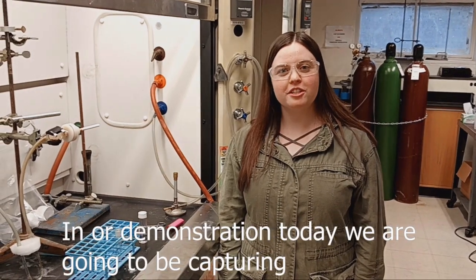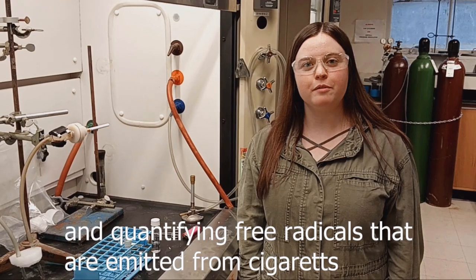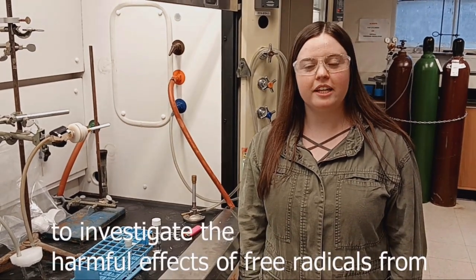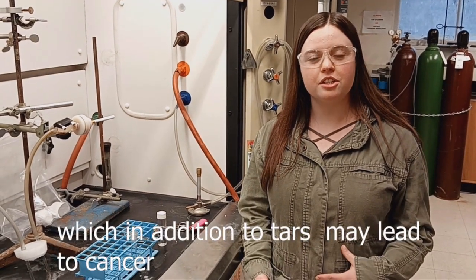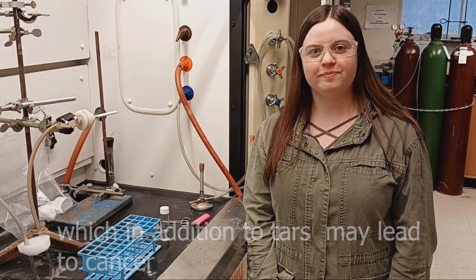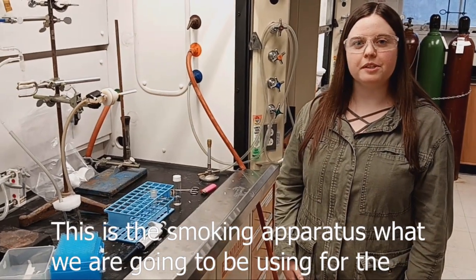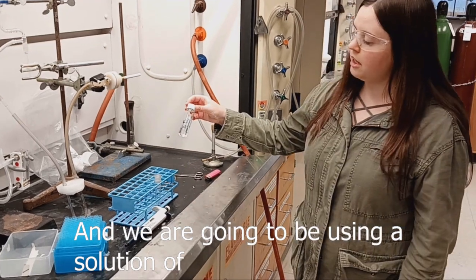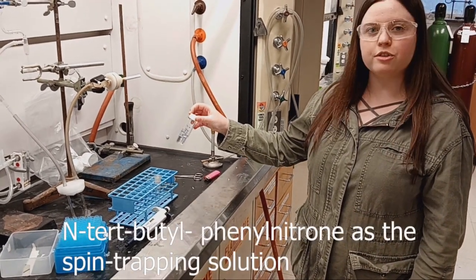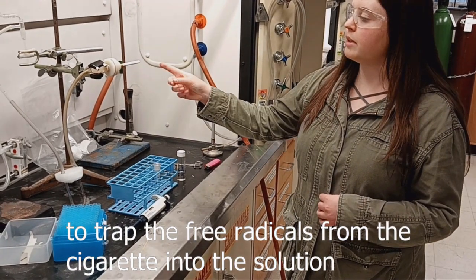In our demonstration today, we are going to be capturing and quantifying free radicals that are emitted from cigarettes to investigate the harmful effects of free radicals from tobacco smoke, which in addition to tars may lead to cancer. This is the smoking apparatus that we are going to be using for the simulation. And we are going to be using a solution of N-tert-butyl phenylnitrone as the spin trapping solution to trap the free radicals from the cigarette into the solution.